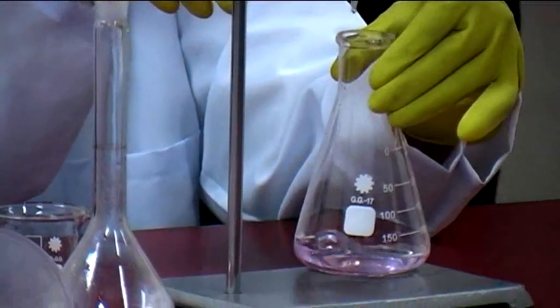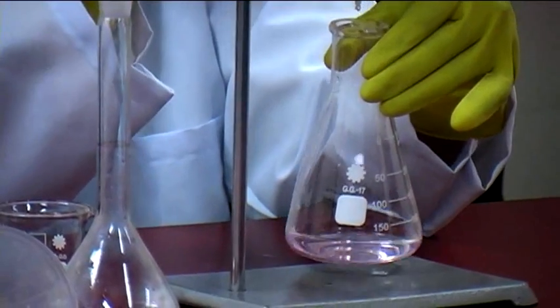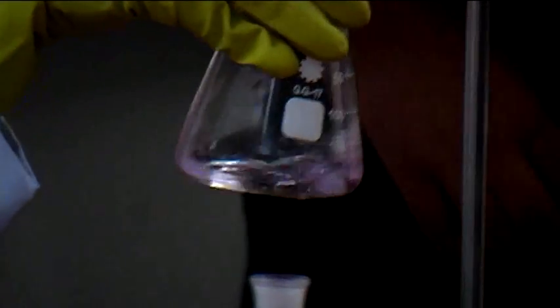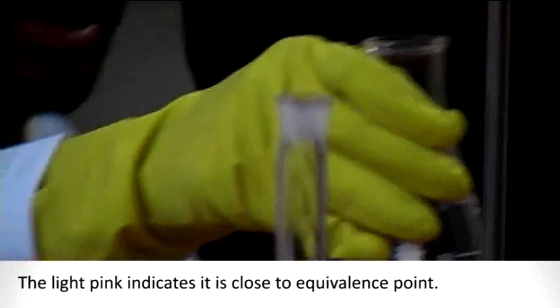Okay, we have a look. What are you going to do? Can anyone notice any difference? It is a lot lighter.